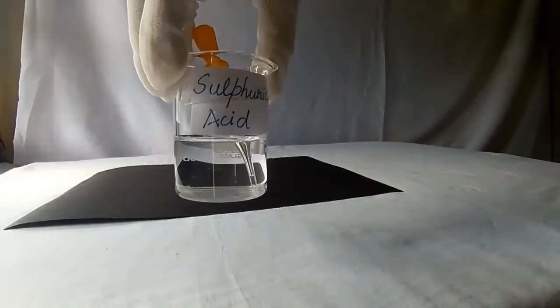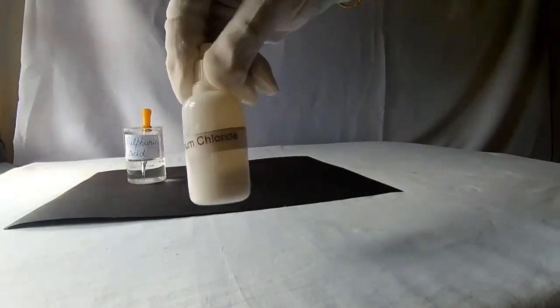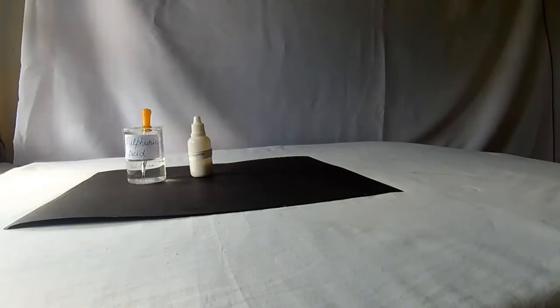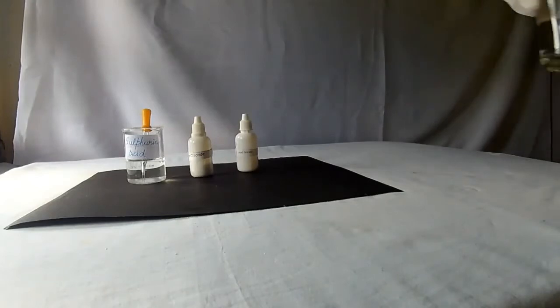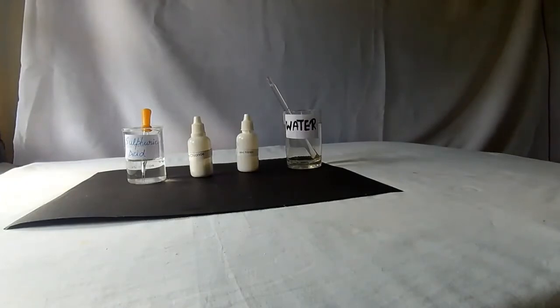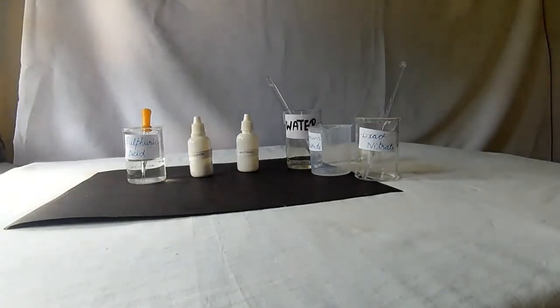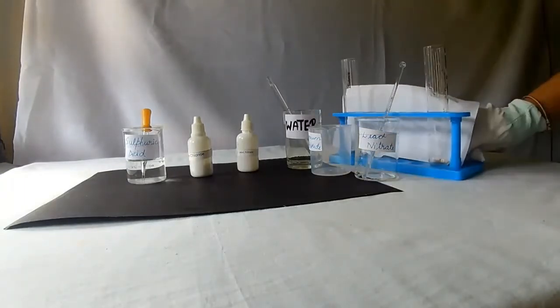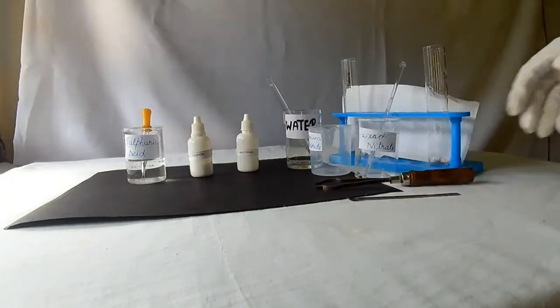Take dilute sulfuric acid, barium chloride salt, lead nitrate salt, water, beakers to prepare the solutions, a test tube stand, a spatula, and a test tube holder.